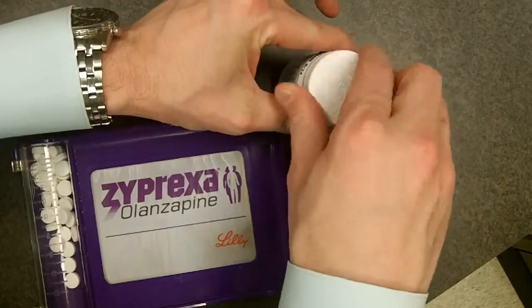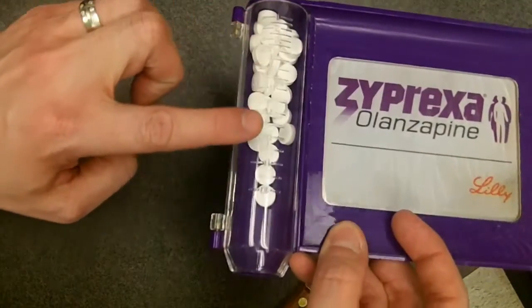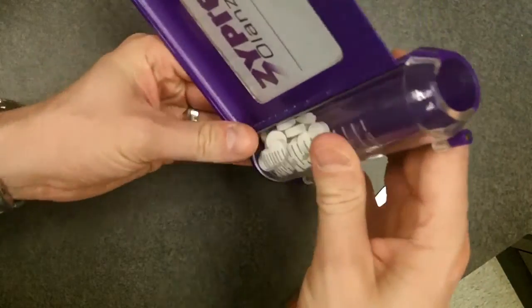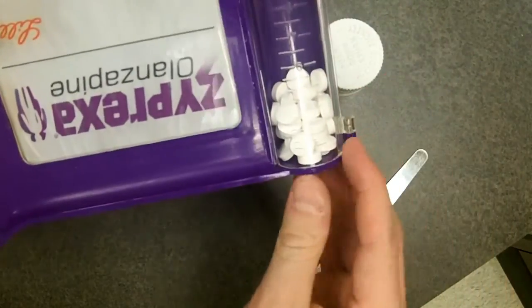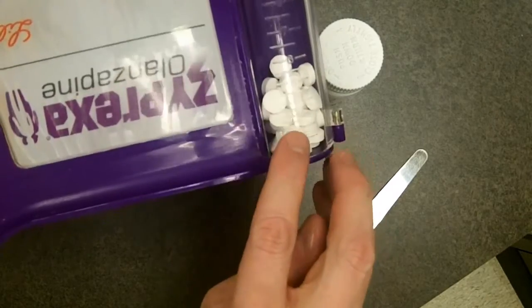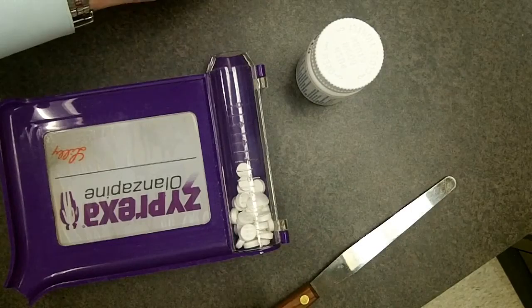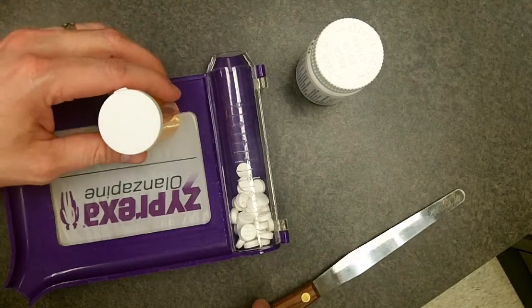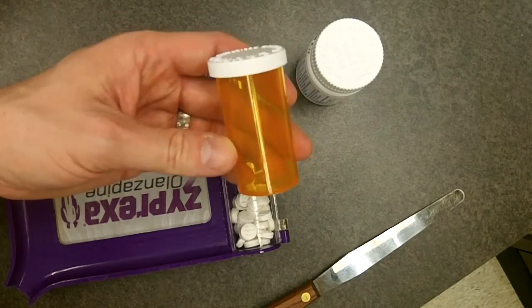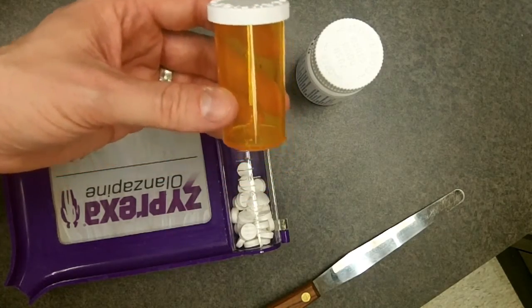Go ahead and close your stock bottle up. You'll notice there are some markings on the edge of this counting tray — they're tough to see on camera, but if you put your capsules up you can see it comes to about 4 or 4.5 to 5. If you double the number on the counting tray that gives you the bottle size you need, known as DRAMS. That was about 5, so doubling gives me 10.